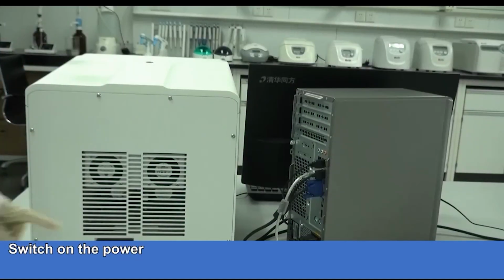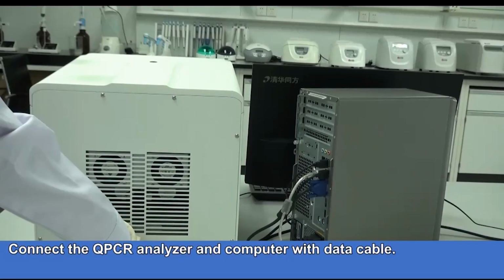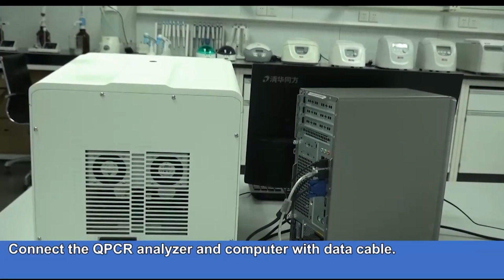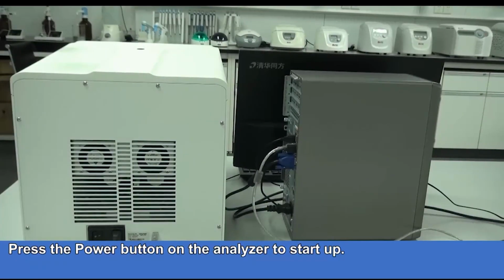Switch on the power. Connect the analyzer and computer with data cable. Press the power button on the analyzer to start up.